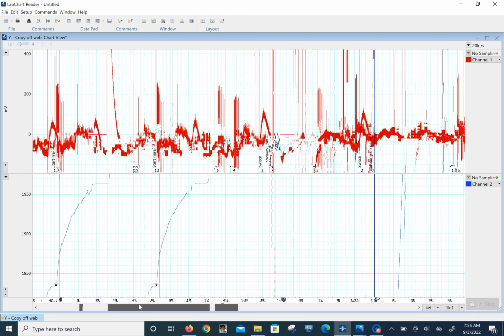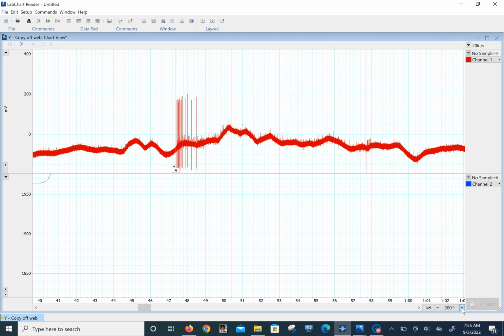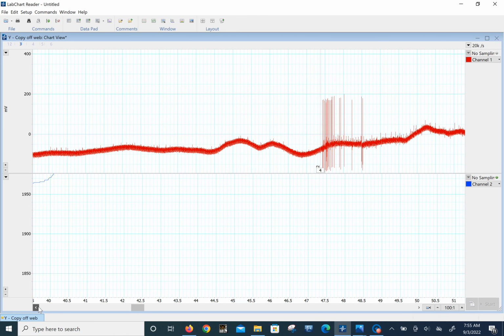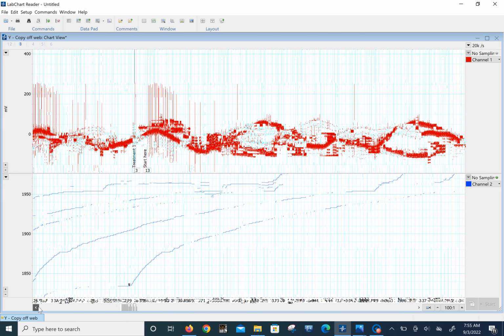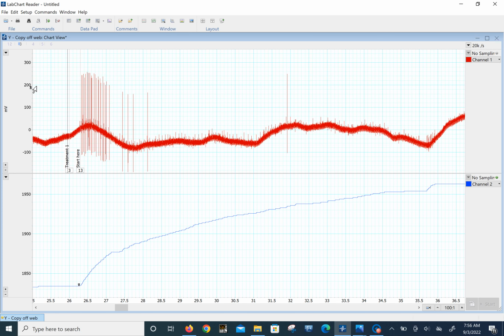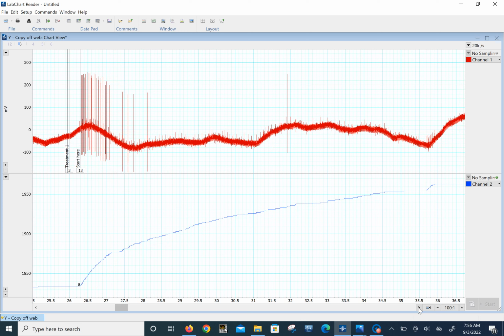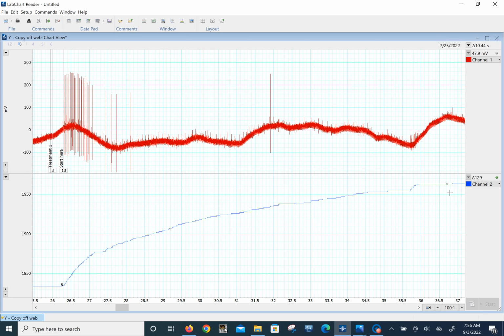Let's blow this up a little bit. Let's look right here, go down here and extend this out. Try to get to the first one, which is right here. So the spikes, you can change this amplitude here, and we see that we get some very large spikes. And then there are not these little spikes over here. There's a few, but you see that there's more of them in here. So it probably is really neural activity. It's probably the static sensitive cells that are firing. Okay, let's go up here and get an idea of what we want to do for analysis.